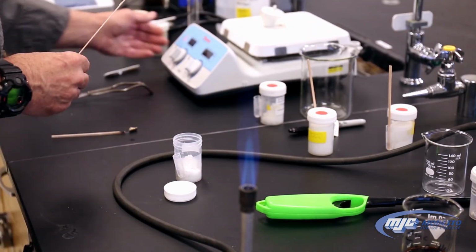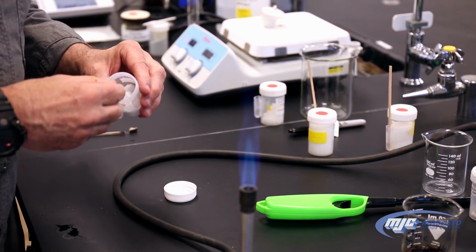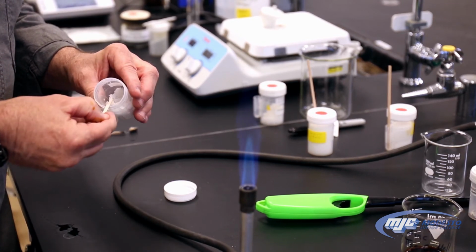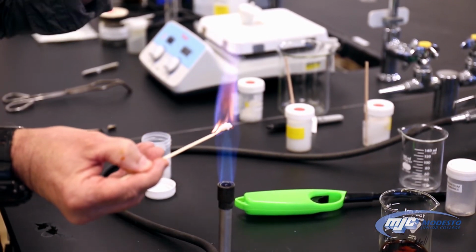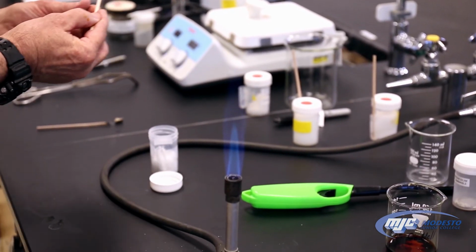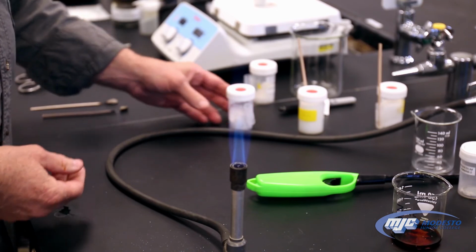By the way, it's been 5 minutes, so what I do is I'm turning up the heat on my hydrate. Put this in the flame. See that purple color right there? That tells us we have potassium atoms in our unknown, and that means that our anhydrous salt is potassium carbonate. Now, if you don't see either of those two colors, then you get to do the magnesium strip test.